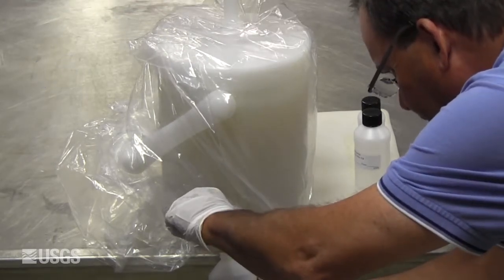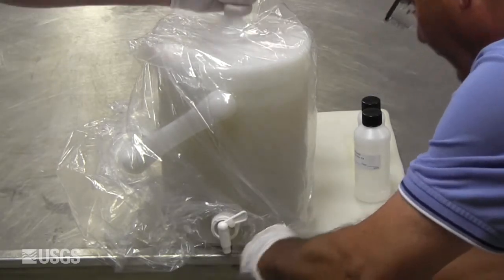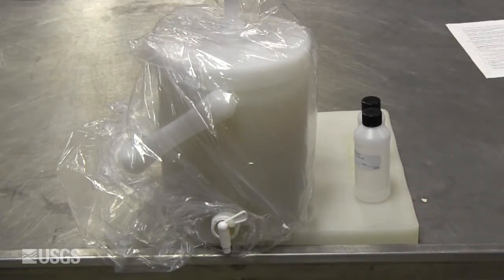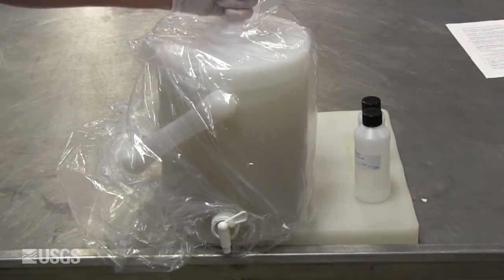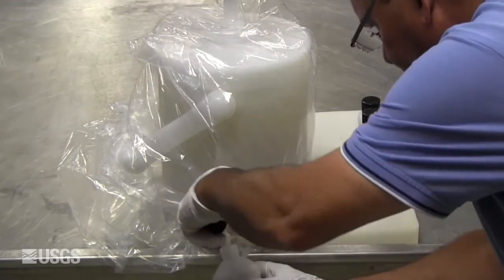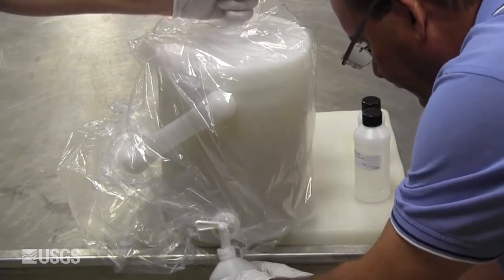If the churning rate is significantly greater than 9 inches per second, or if the disc breaks the water surface, excessive air is introduced into the sample and that could affect dissolved gases, bicarbonate, pH, and other sample characteristics.